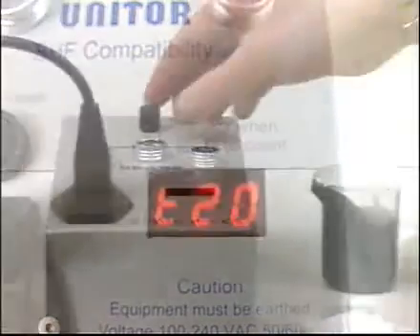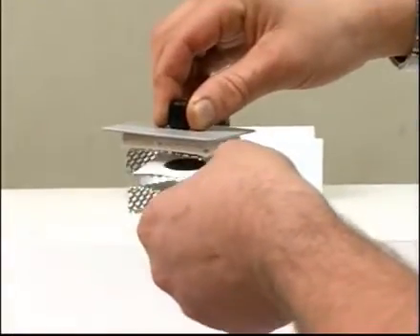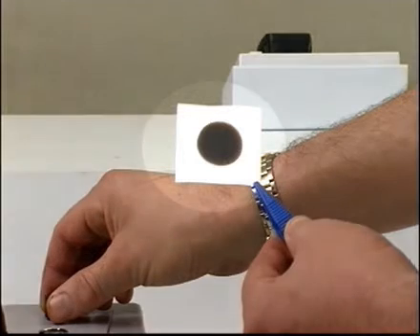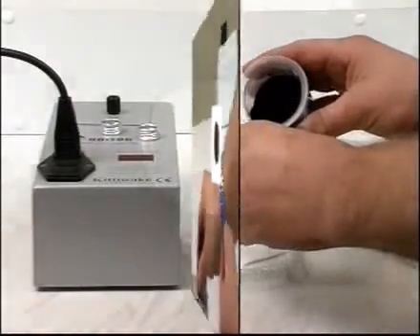Place the paper in the removable tray section and replace it in the oven. Reset the timer and wait for another 20 minutes while the spot dries and develops. Remove the paper and compare it against the spot rating chart in your user manual. Ignore all other characteristics of the spot except the center ring.